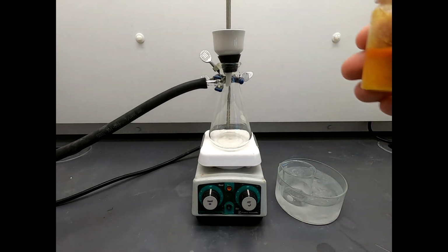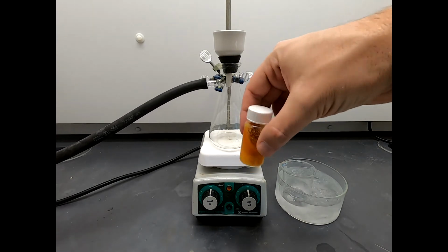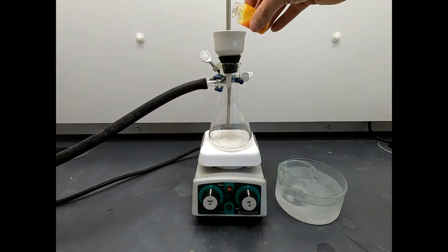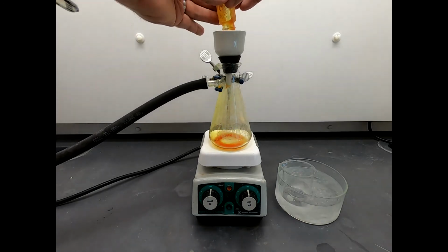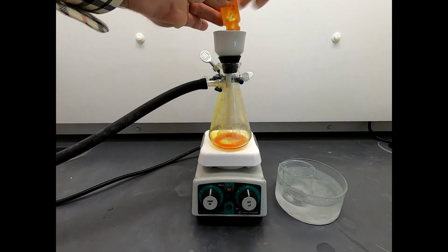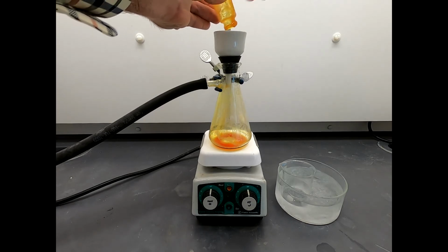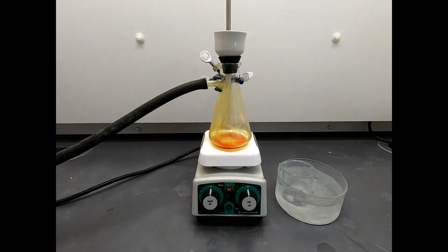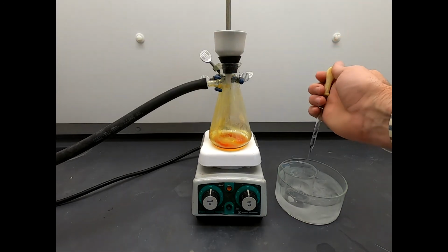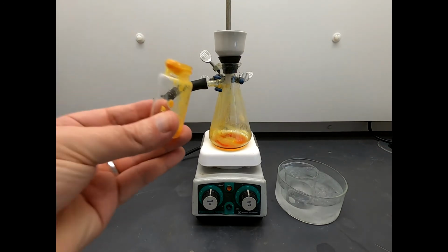Now let's go ahead. We have suction, and now I'm going to take this mixture and just dump all this in. That is thick with solid. Looks great. Look, a bunch of colored impurities are going through. But it's not as if what's in the top of the funnel is colorless, because it is not. Okay, and that's what we're going to do some rinsing for with cold methanol.